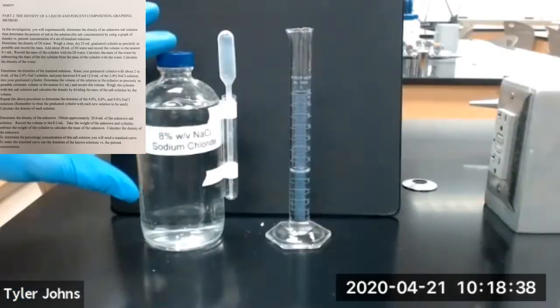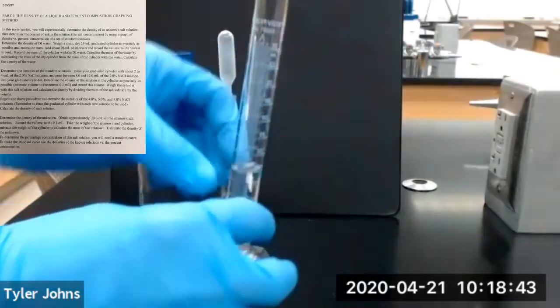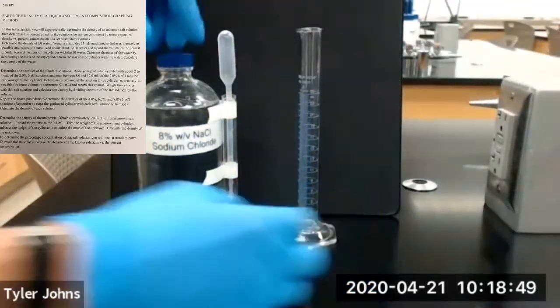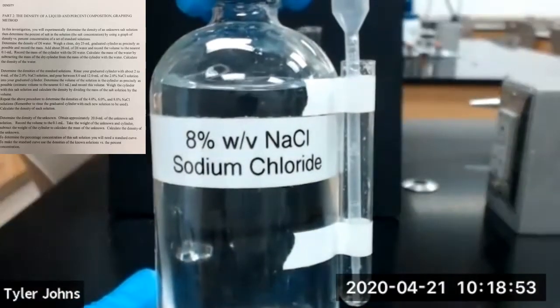Okay, so we're going to move on to our next standard salt solution. So we're going to dump our remaining 6%. Our next standard salt solution is 8% sodium chloride.